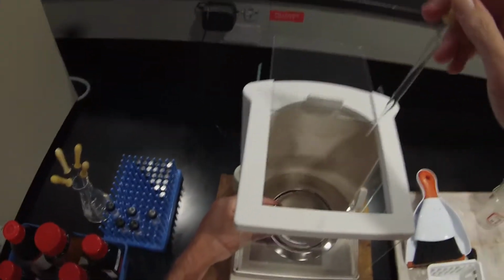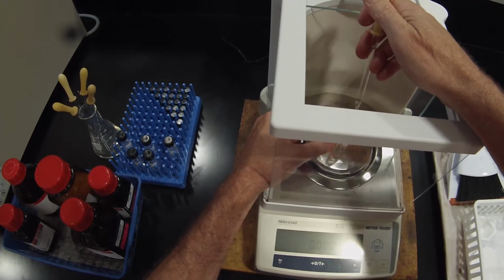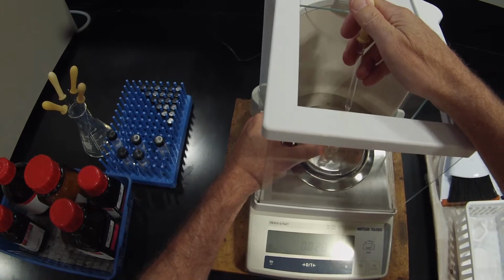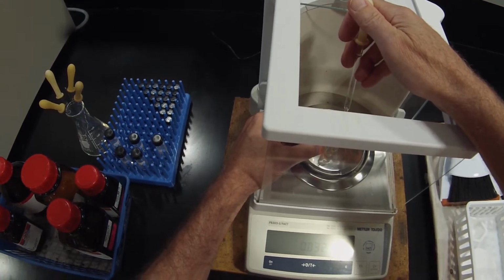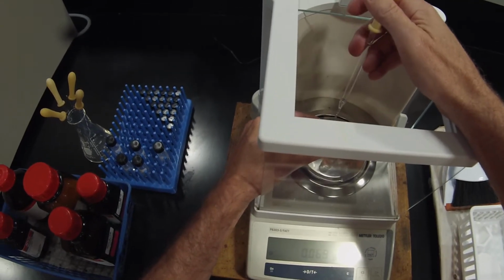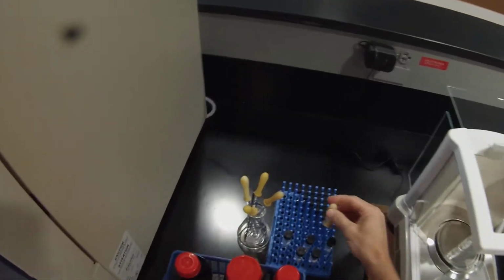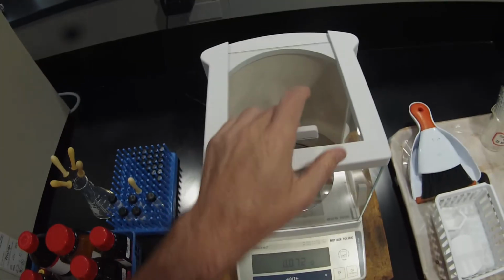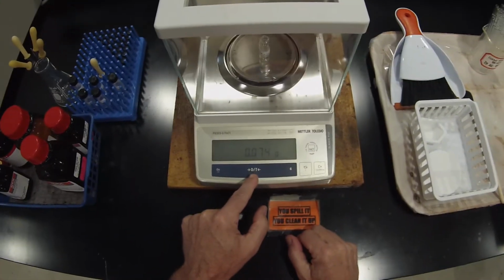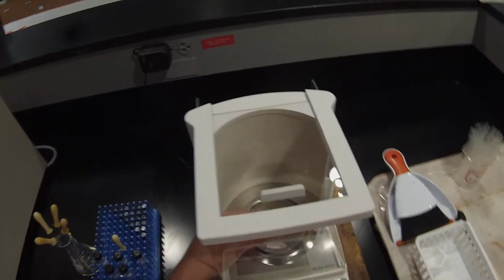And then I want to drip in enough of the linalool. I have about 60 milligrams. I don't want to overshoot, so I'm going to keep the amounts as close as I can. It's not critical that it be exactly 60 milligrams, but we want a concentration as close as possible to 20 milligrams per milliliter as we can get. Close these guys up so we can get a nice accurate reading. It looks like we got 0.074, 0.073... it seems to be stabilized at 0.072. So we got 72 milligrams of linalool.